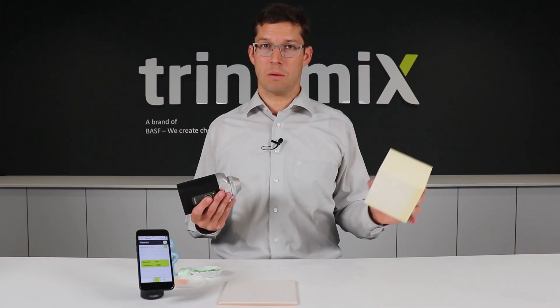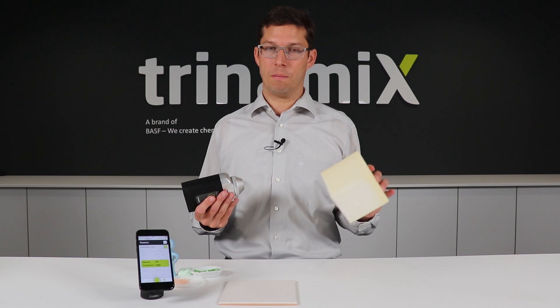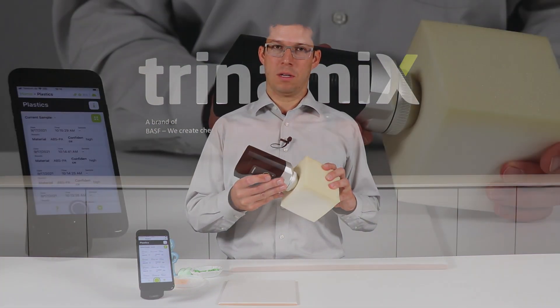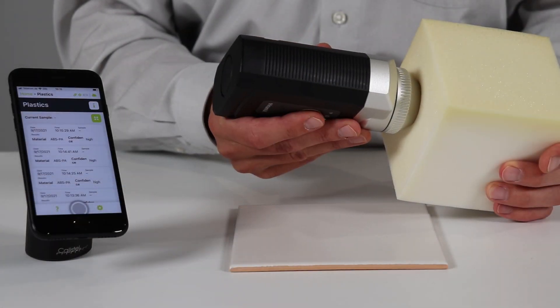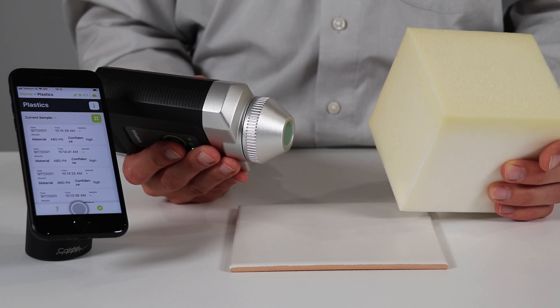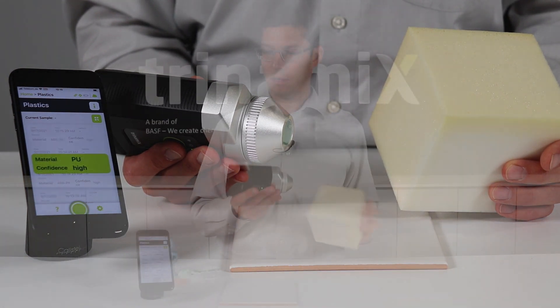Last but not least, we also have a sample of a foam here. Push the spectrometer inside and start the measurement. And that's how you get a good result here as well.